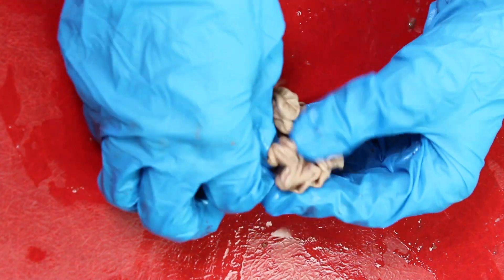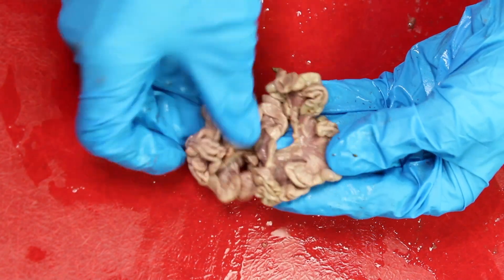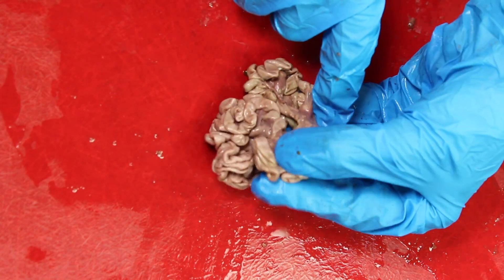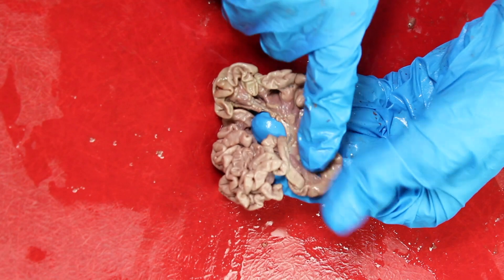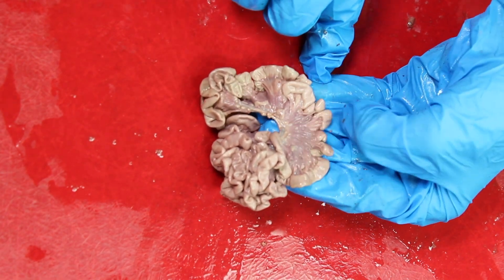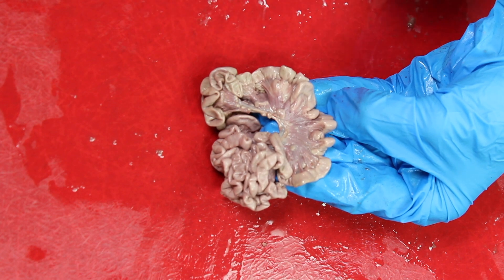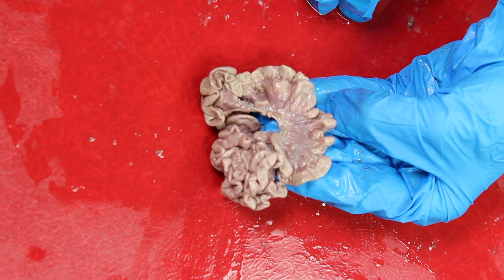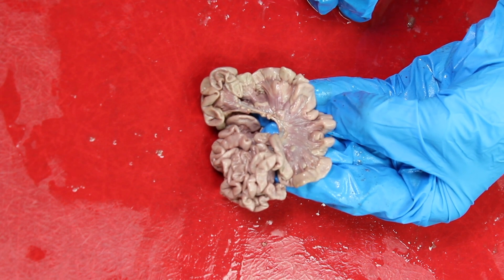There is a significant quantity of connective tissue, or mesentery, holding the small intestine in its convoluted shape. This tissue is rich with a complex structure of blood vessels to ferry nutrients from the small intestine into the body.